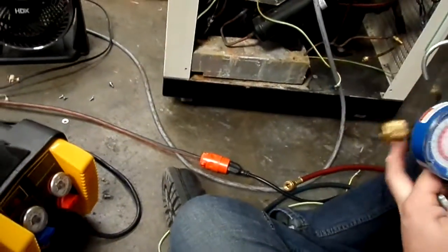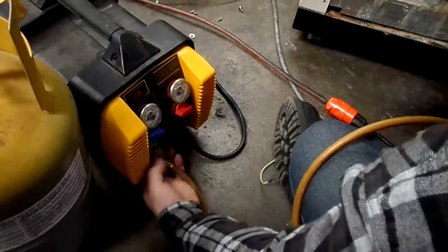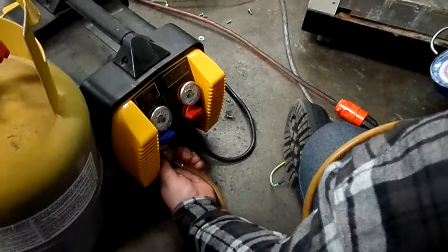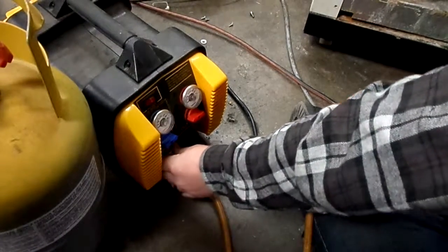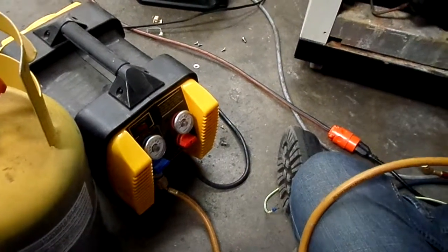Okay, so now we're going to recover. So our yellow is going to go into the input of our recovery tank. And then I'll need a spare hose. There's one in that bag over there. Yeah, the yellow hose in there.